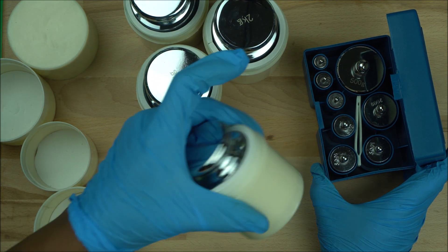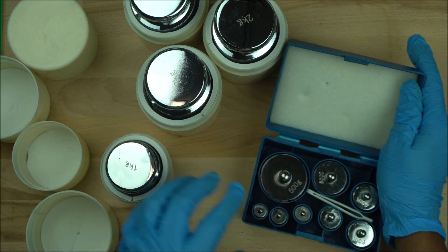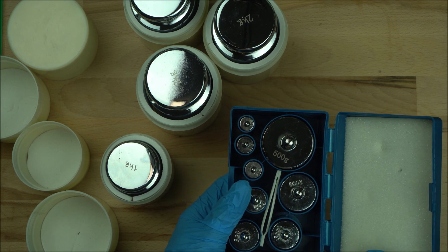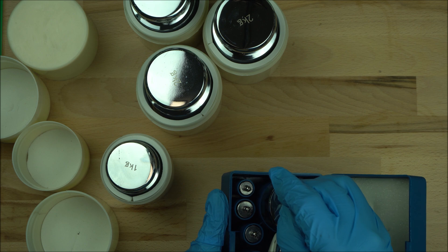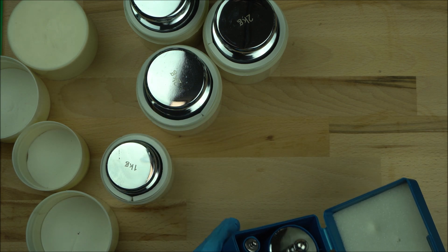If you need 1 kg and you cannot afford this, for instance—though it's cheaper than this—you can go ahead and get yourself a set. In this set I have 1,000 grams, so you can also use this. Just make sure you take everything one by one and drop them on your scale when your scale prompts you for the calibration weight.